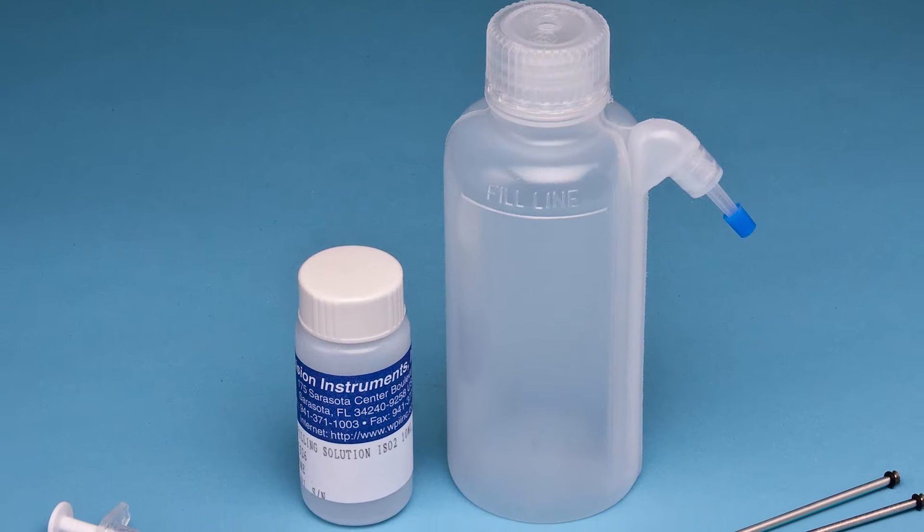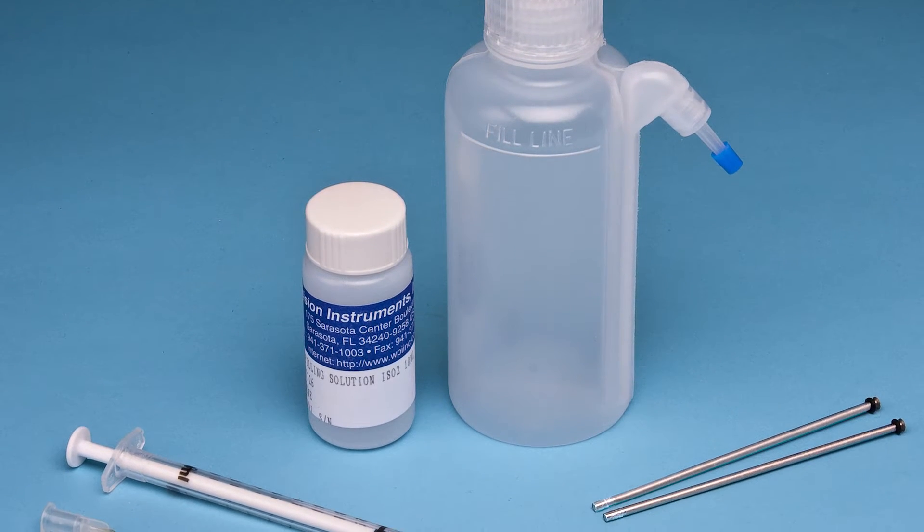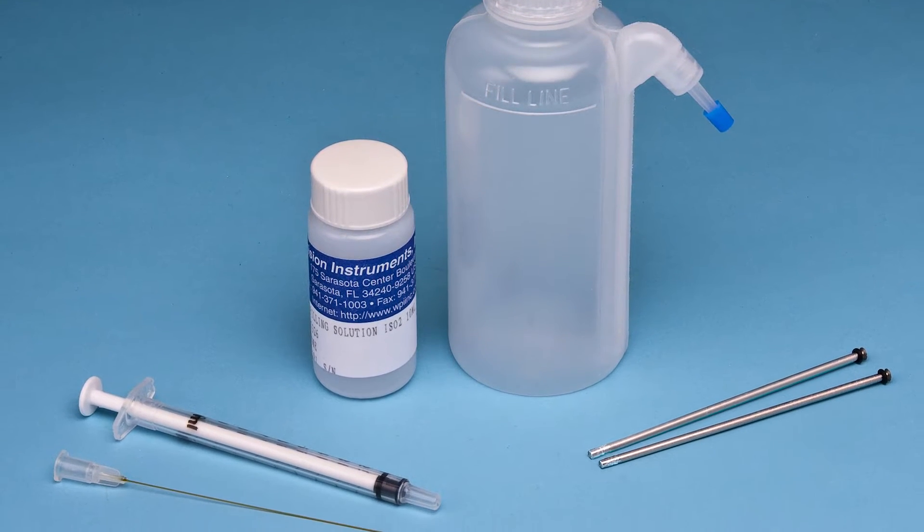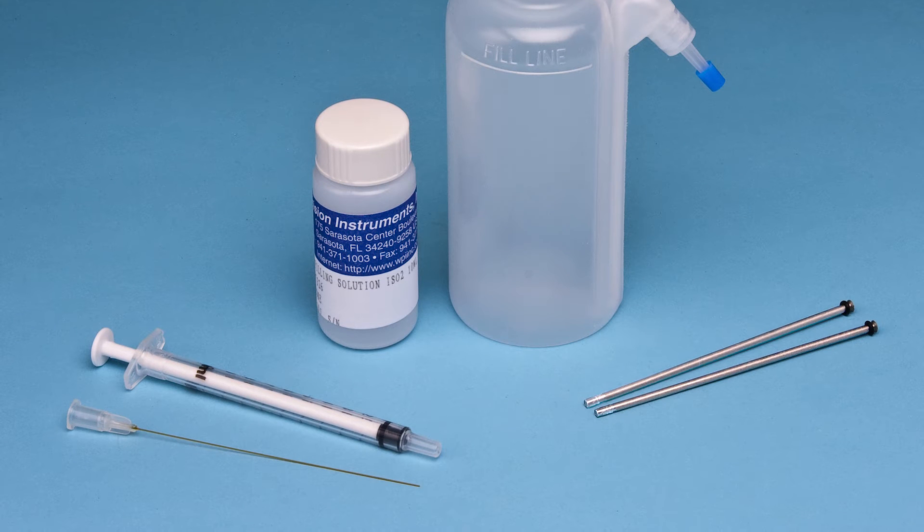The startup kit contains everything you need to prepare the sensor including a bottle of electrolyte solution, a syringe, and a microfill non-metallic filling needle.